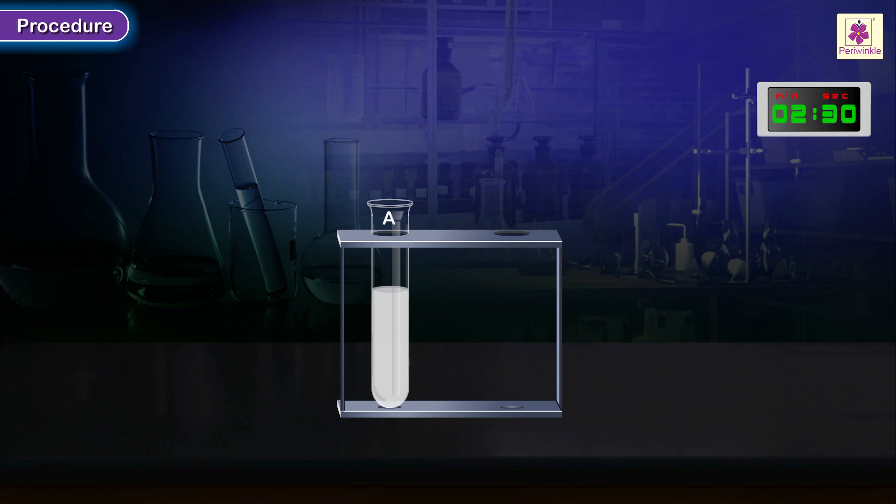Procedure: Leave the test tube undisturbed for about 20 minutes and then observe its content.